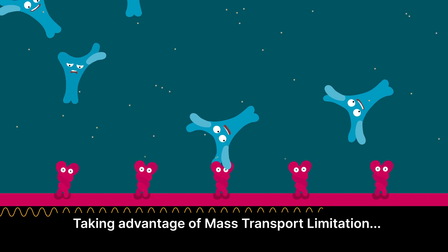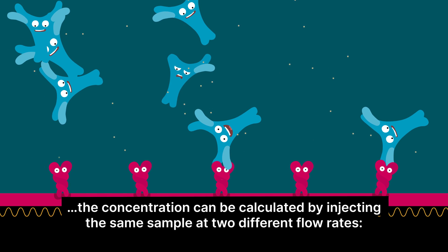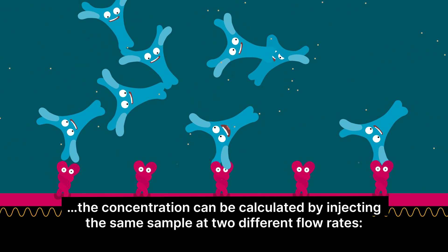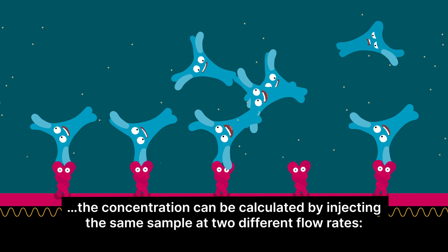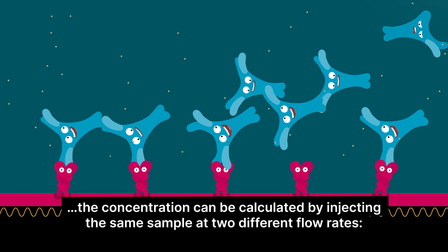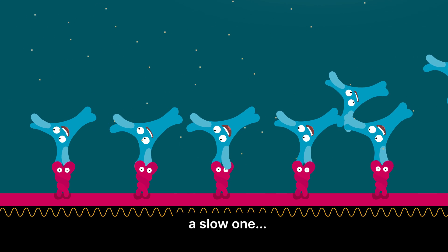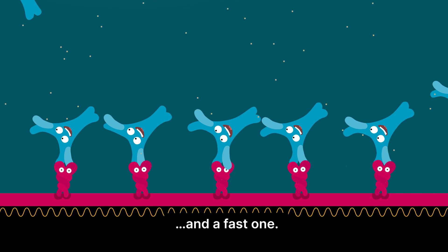Taking advantage of mass transport limitation, the concentration can be calculated by injecting the same sample at two different flow rates: a slow one, and a fast one.